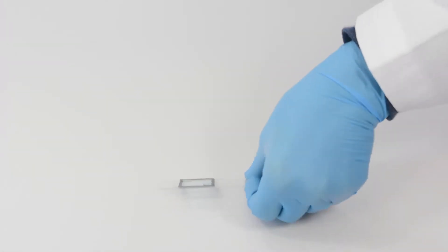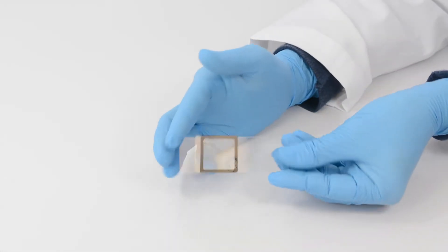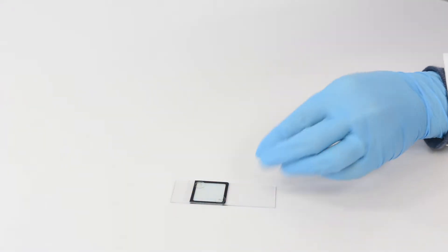This creates a chamber that prevents evaporation and will contain your reaction at temperatures up to 97 degrees Celsius.